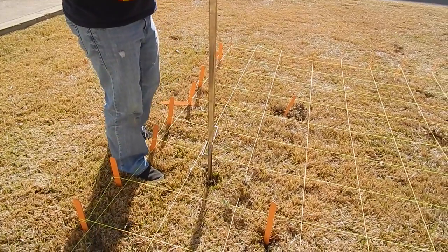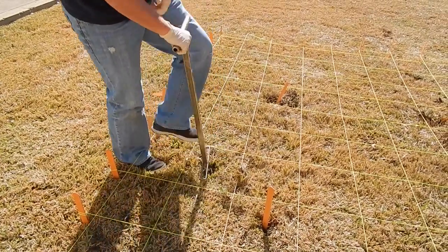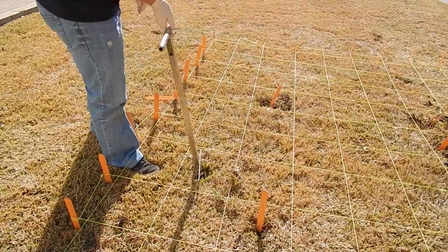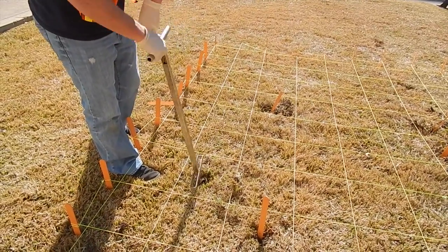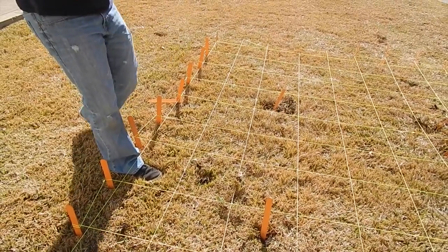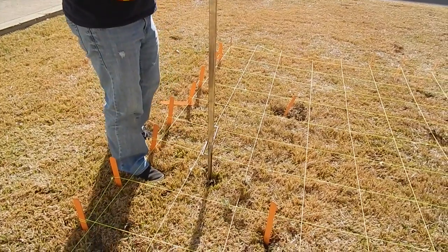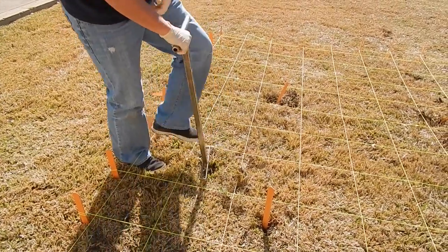It may be advisable to remove the first 3 to 6 inches of surface soil for an area approximately 6 inches in radius around the drilling location. After reaching the desired depth with the auger, slowly and carefully remove the auger from the hole. When sampling directly from the auger, collect the sample after the auger is removed from the hole and proceed.